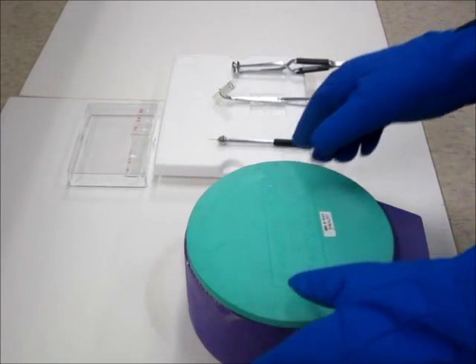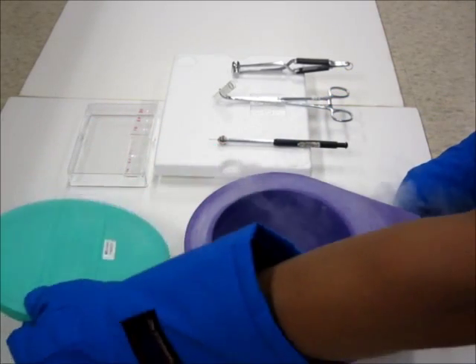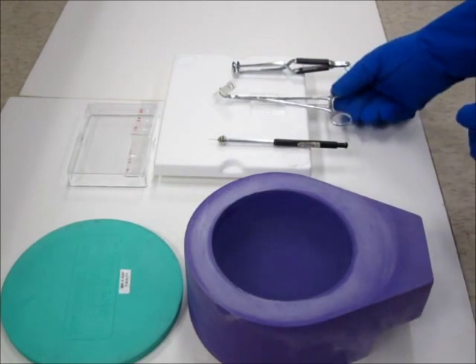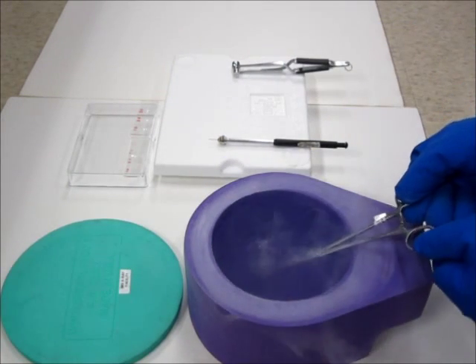In this video, I am going to demonstrate how to flash cool a crystal in a cryo vial using bulk nitrogen.